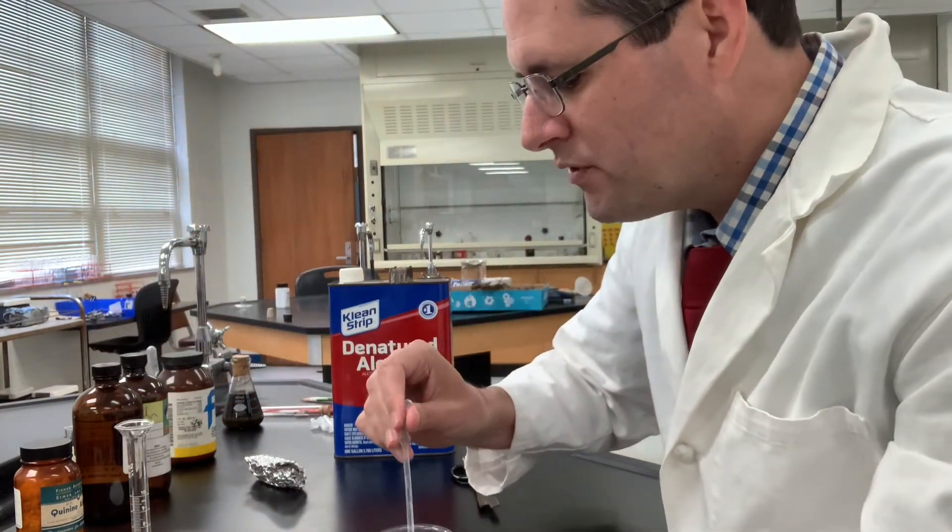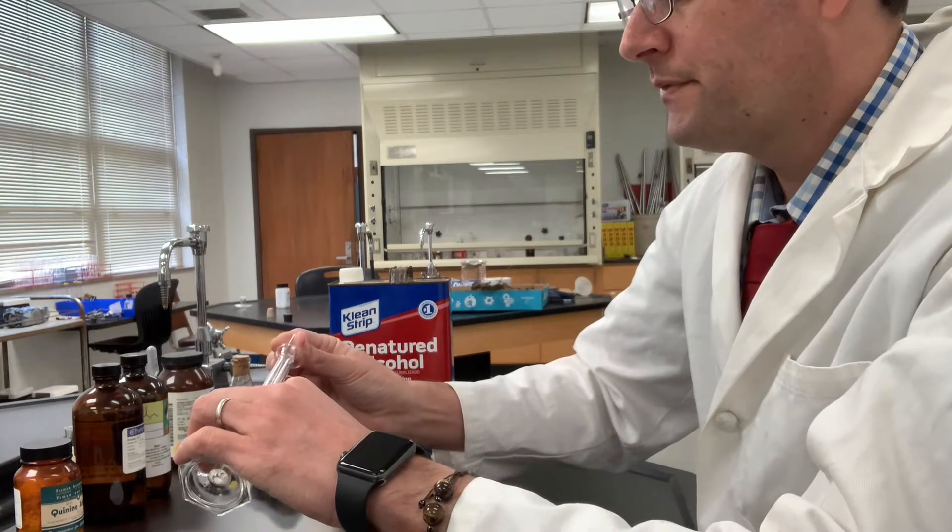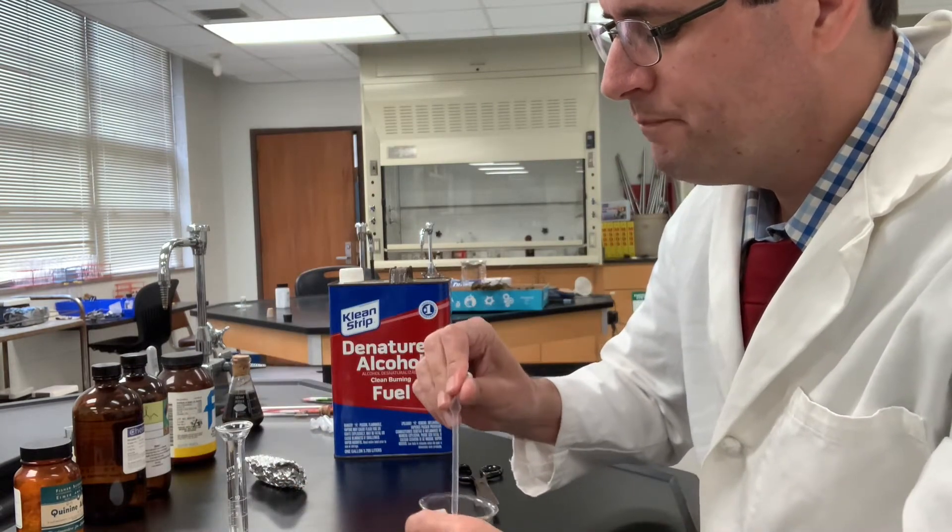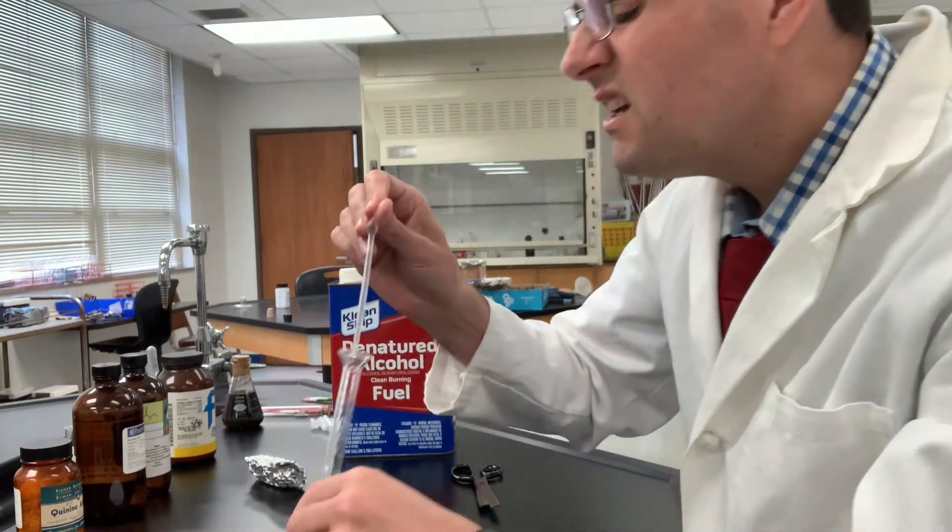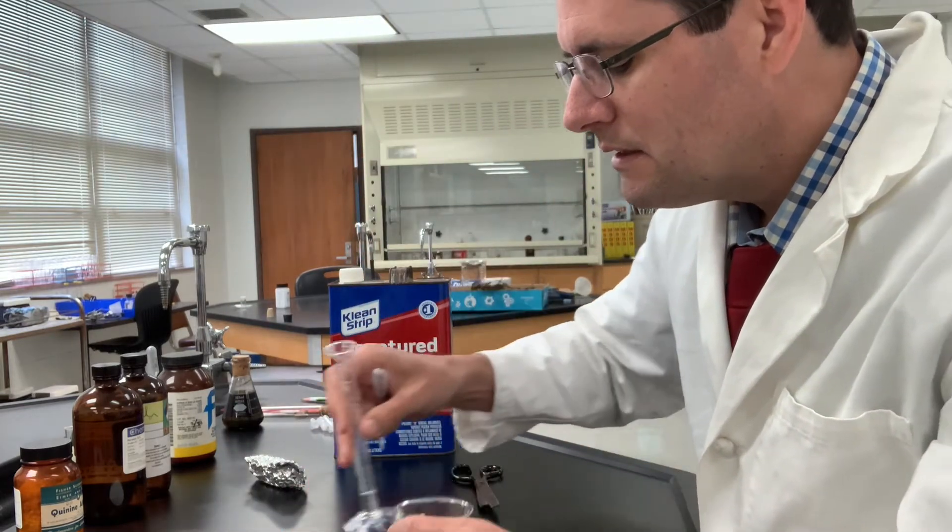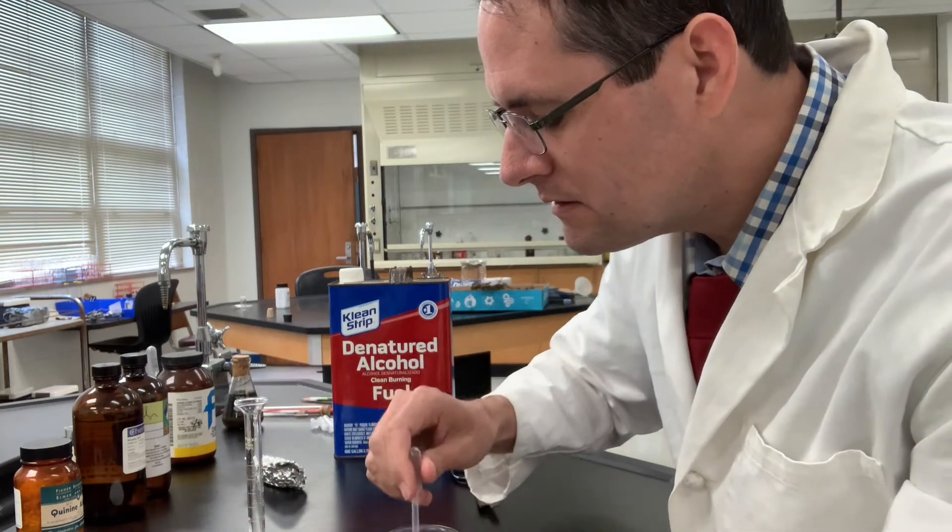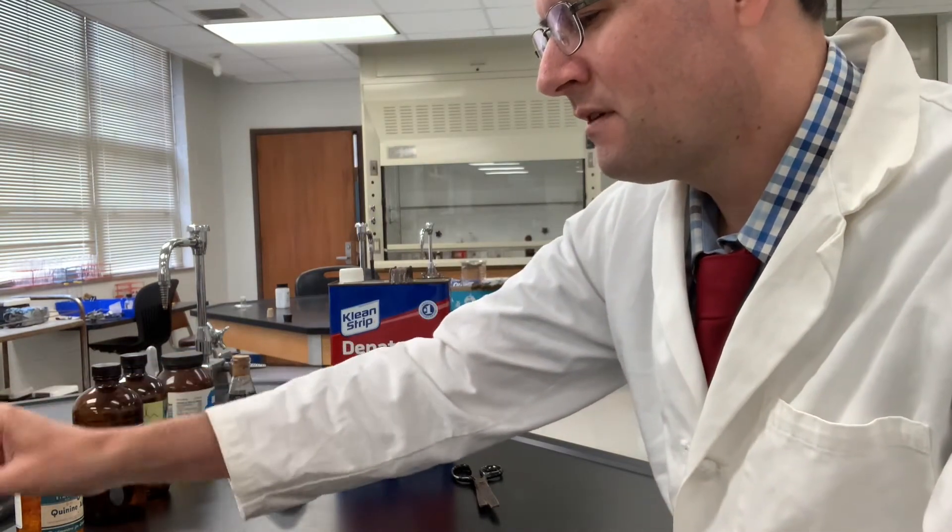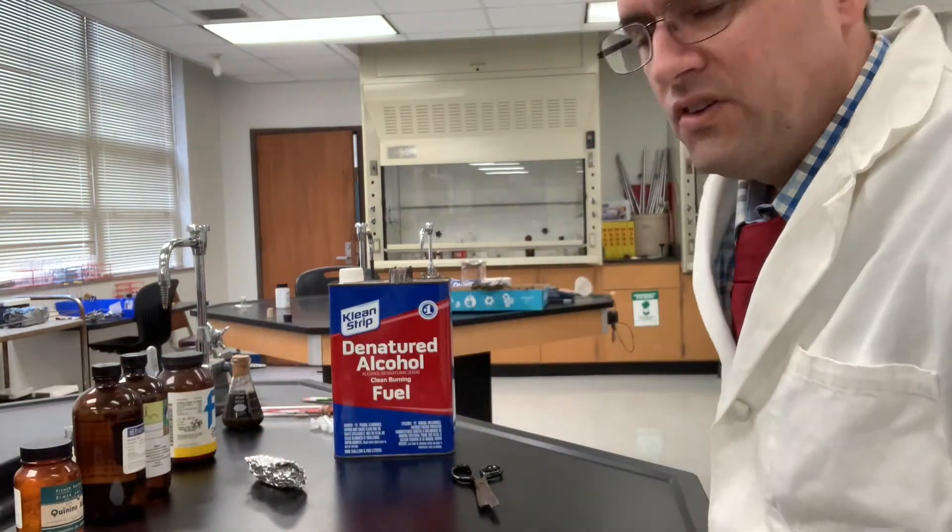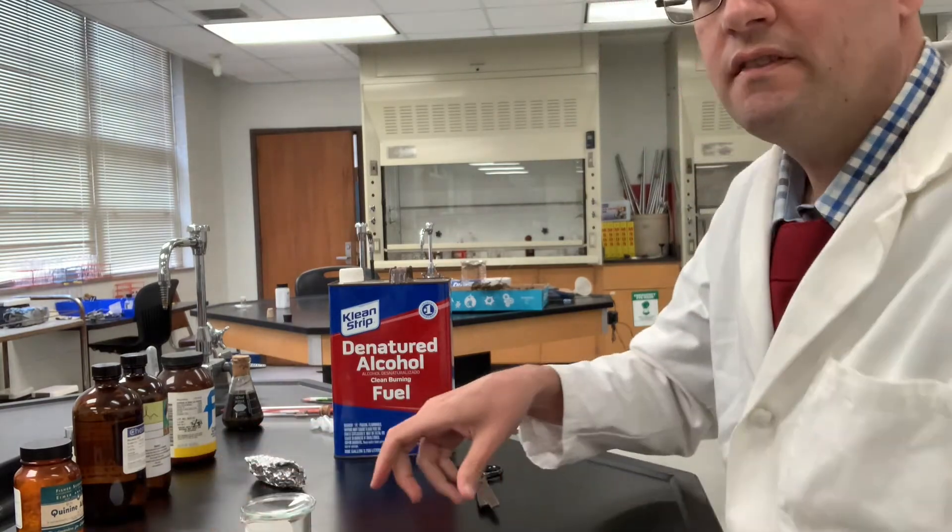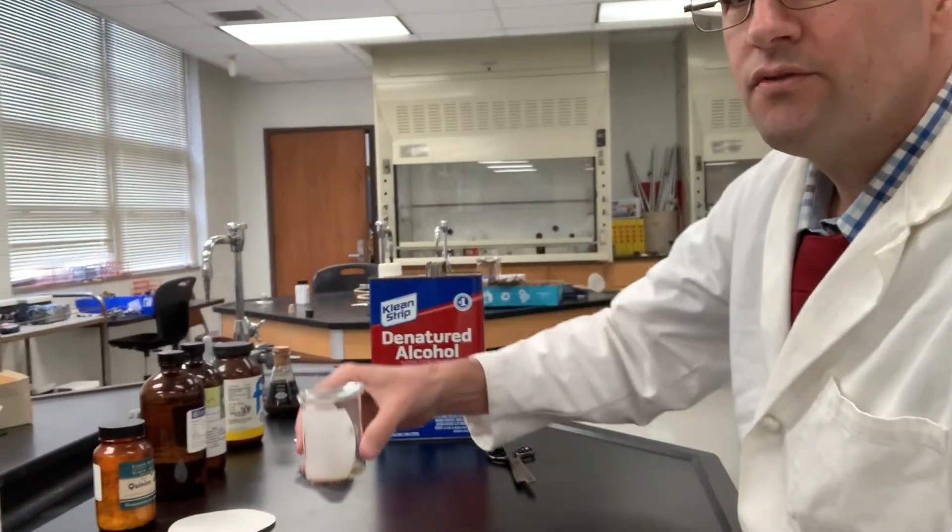Now we put some on the bottom there, of course, and put some on the filter paper. That's probably pretty good. So I put in about six milliliters of solvent. We'll cover that up and we'll just let this sit for a while.